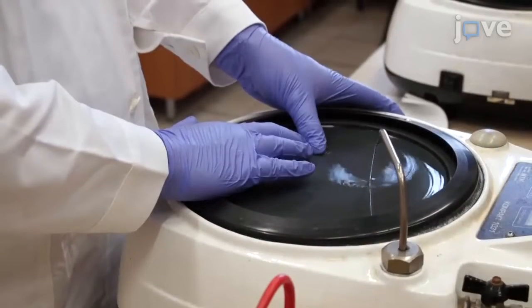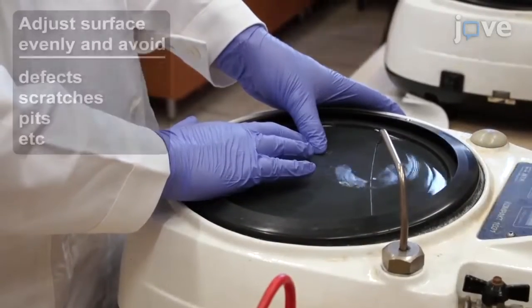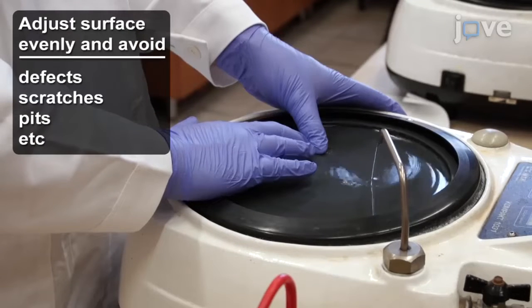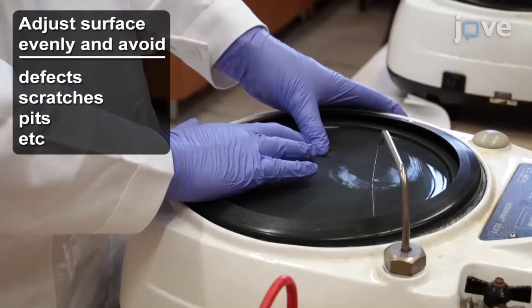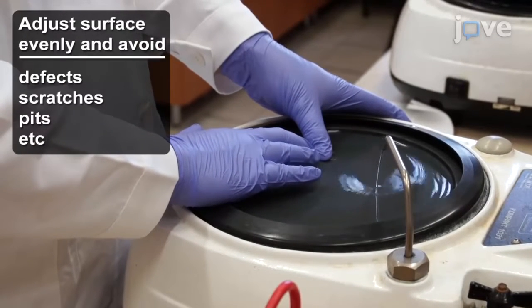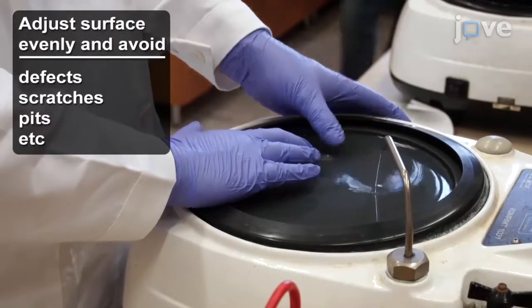Use 1200 mesh sandpaper to grind and polish the surface of the metallic sample under running water to achieve an even adjustment of the surfaces.